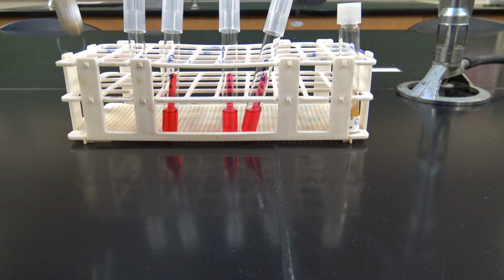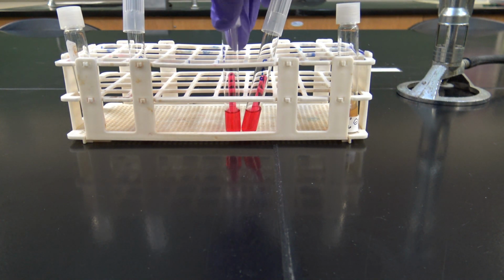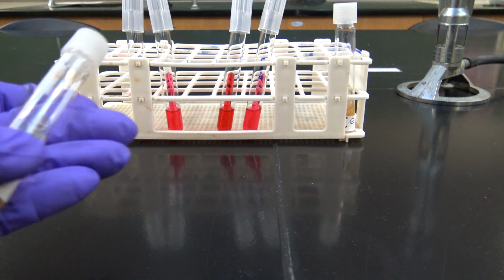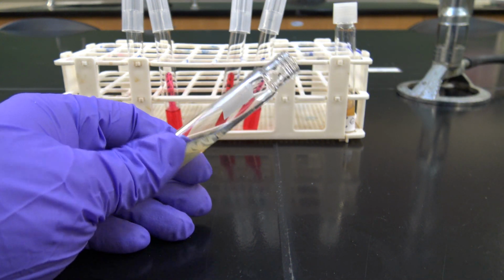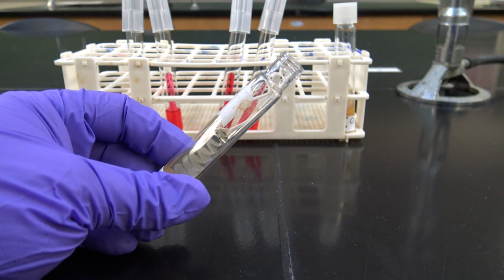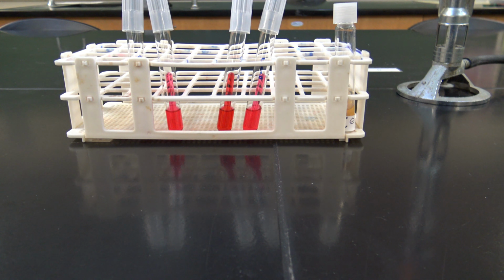Okay, so I'm going to start with our gram-positive here, and I'm going to do a glucose and a lactose. So when you're working with the slant tubes, we're going to remove the cap, and then I'm going to flame the lip of this on the Bunsen burner just to decontaminate anything that's on the outside of it. And also, obviously, I'm going to sterilize my inoculating loop in the flame.